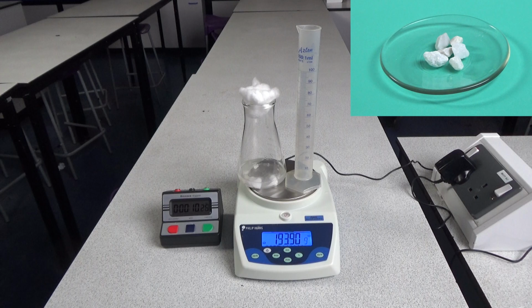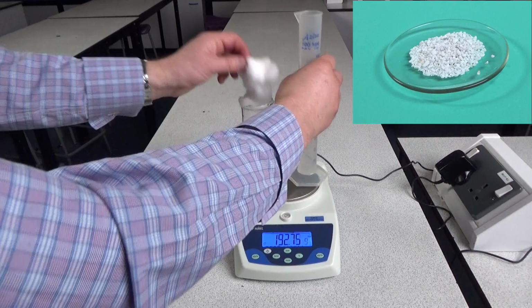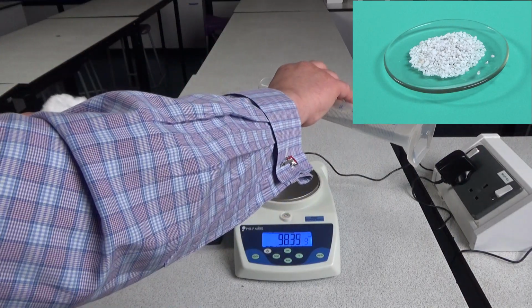get lighter. So I'm going to leave it reacting for 30 seconds, and our control variables are the concentration of the acid. We're keeping that the same. We're also keeping the same mass of the calcium carbonate. We're keeping that at 10 grams each time. So after 30 seconds, we take down the new mass, and the difference in mass is going to be the same as the mass of carbon dioxide given off. I'm then going to repeat it with the small calcium carbonate pieces.